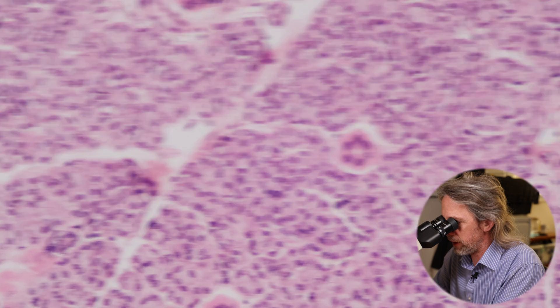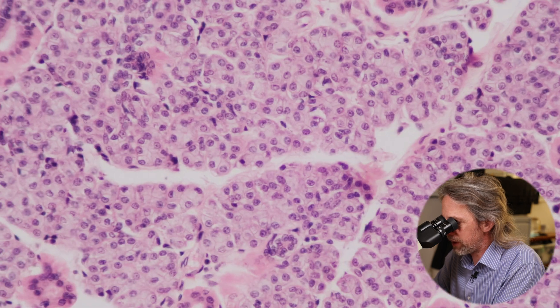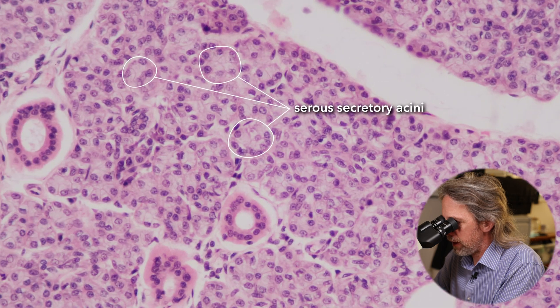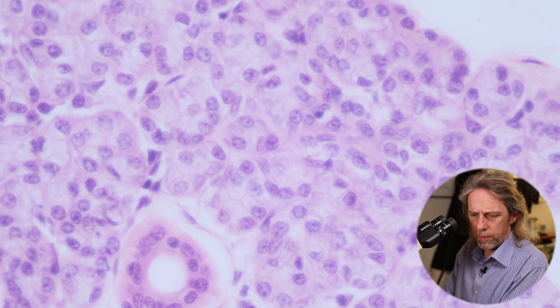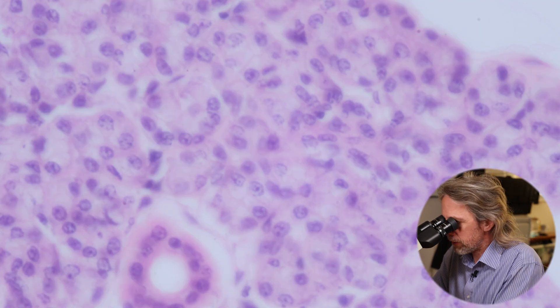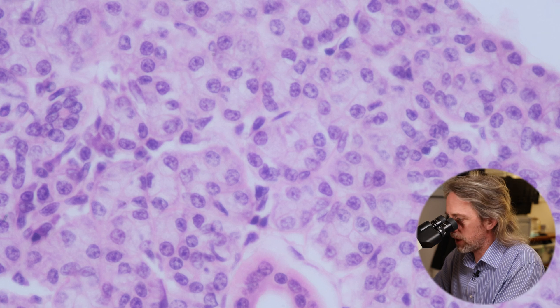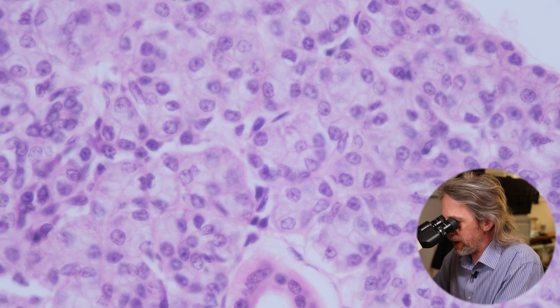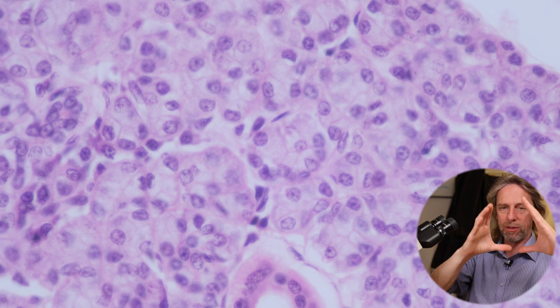At 10x or 20x objective — so 200x magnification — we can see these structures run in a distinctive pattern. It's incredibly neat. Most of the glandular tissue we're looking at: those are some pretty convincing circles there in the middle. Jumping to 400x magnification, you can see how these secretory cells are making circles, and in the middle there is a tiny duct. These cells are all jam-packed together but they are pyramidal cells.